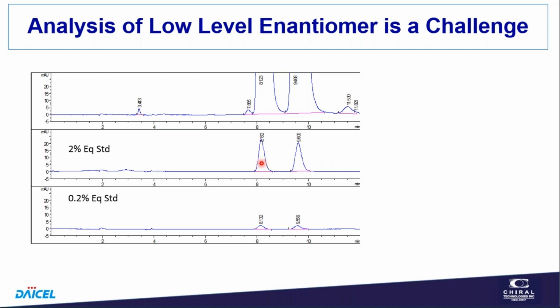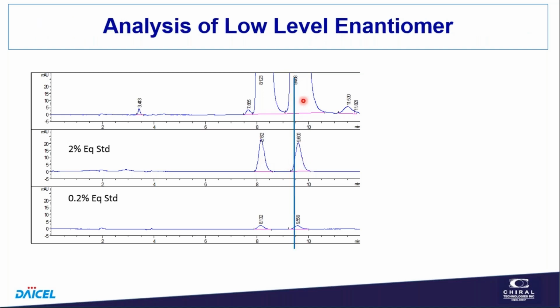The peaks get smaller, and there's not quite as much tailing. Peak width's a little sharper just because of the column overload problem. So it's not a problem, but at low-level components, think about what happens as we bleed some of this isomer into this more retained peak. So you just extrapolate the exponential decay from this peak into here, and you think, well, in this region here, we get a little bit of contribution of this peak to the area of this peak.